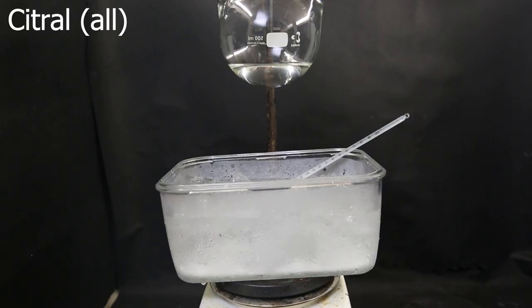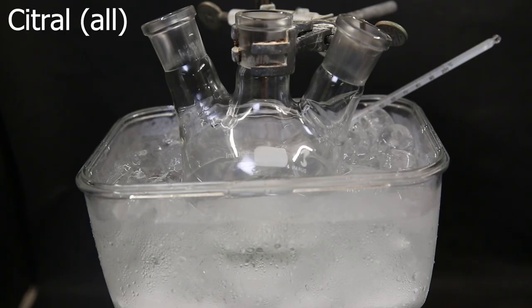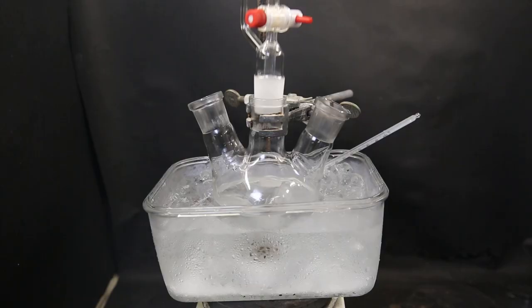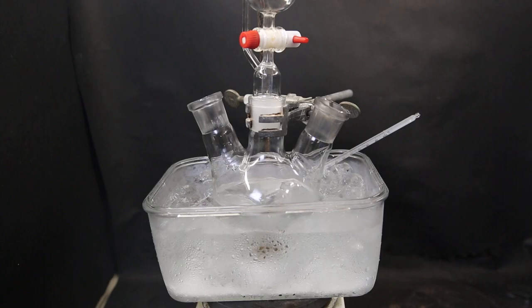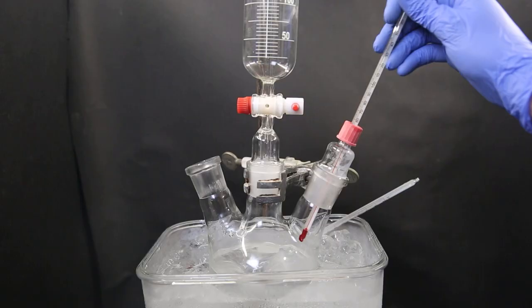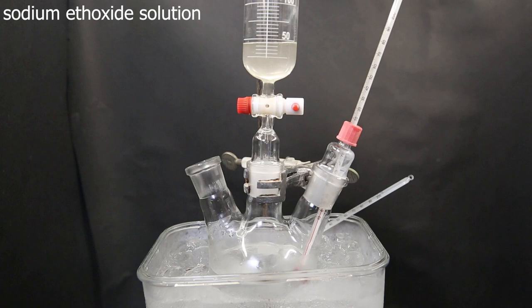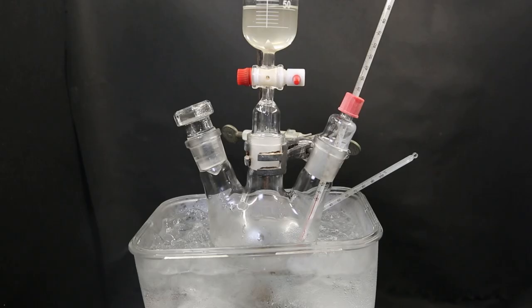So I set up a large flask where I put in all of the citral and an iced salt water bath. I add in the stir bar and 280 mils of dry acetone. Then I attach a dropping funnel and a thermometer. And to the dropping funnel, I add in the sodium ethoxide solution that I prepared before. Now I wait for the internal temperature to reach minus 5C. And then slowly drip in the sodium ethoxide solution.